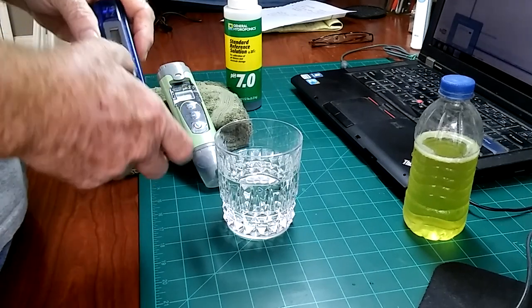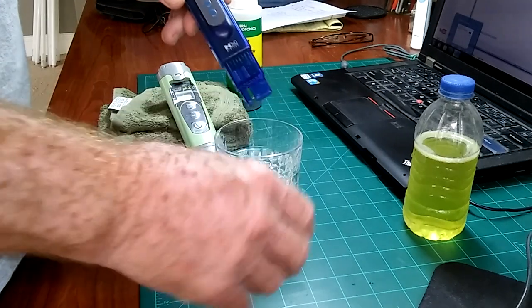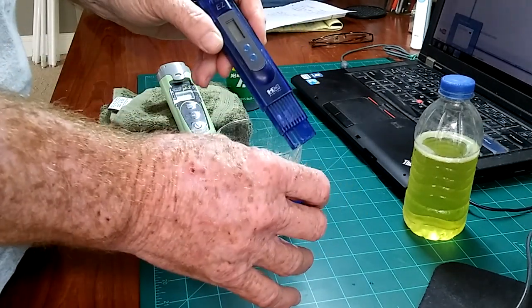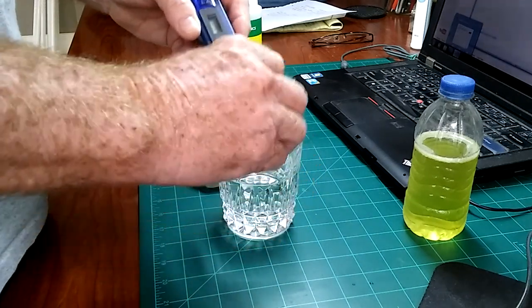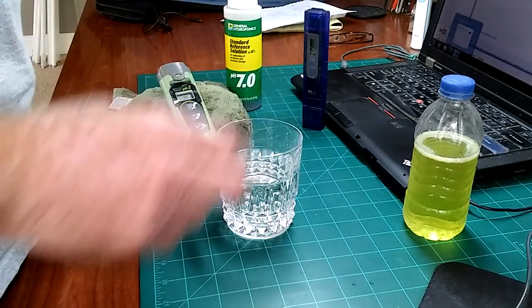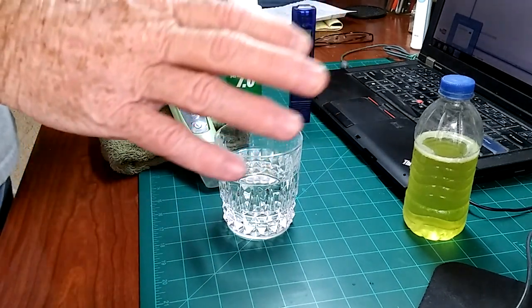That's out of a rain barrel that's getting cleaned this morning. That's all I do to these. I just put this on there without rinsing it, and that's not what you want to do. You want to rinse this off before you use it, or you'll build up mineral deposits on there and that will damage the meter itself. Always store it in an upright position — I have a mug that they just sit down into, and that's all I do for them.